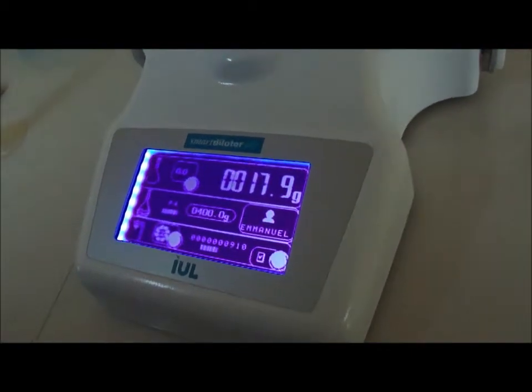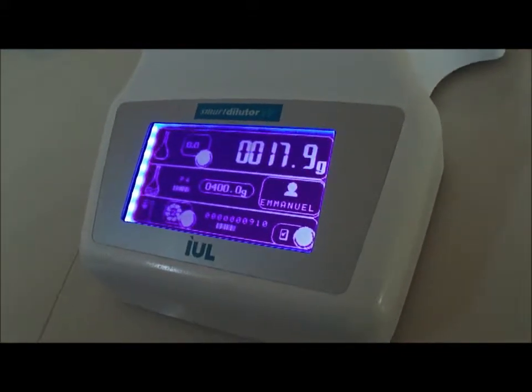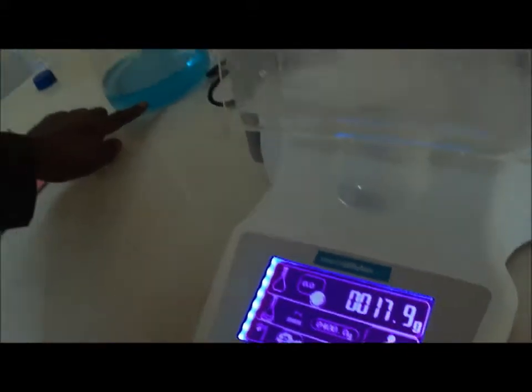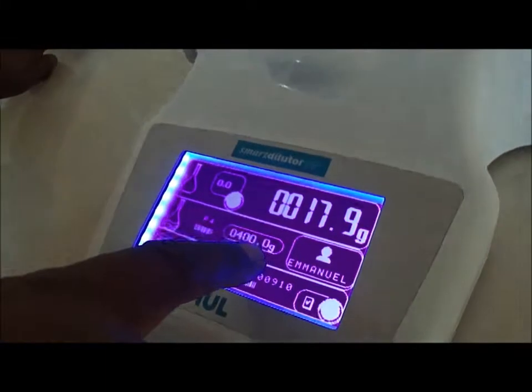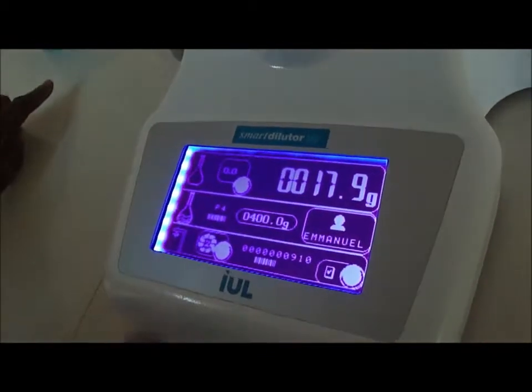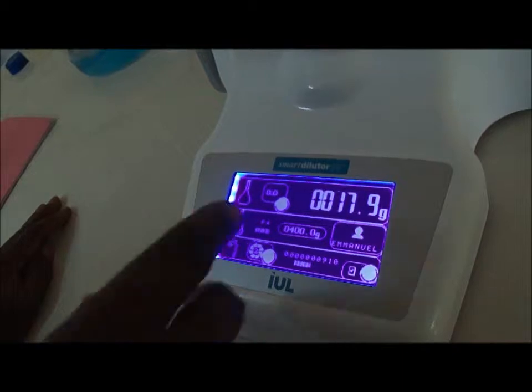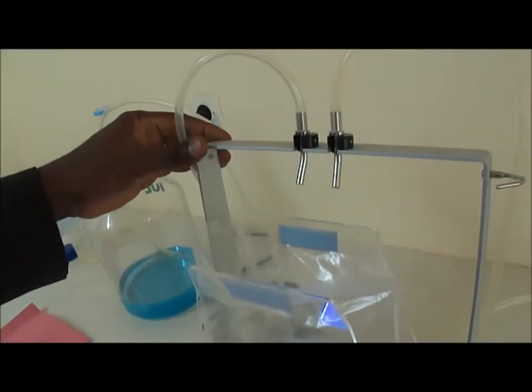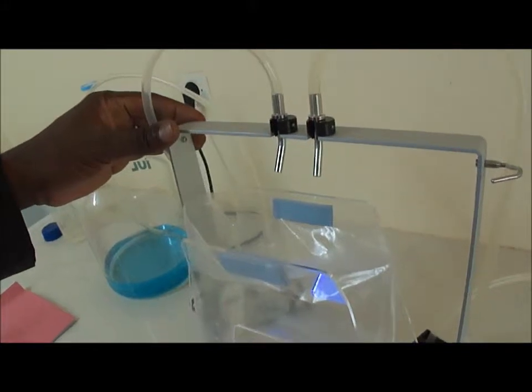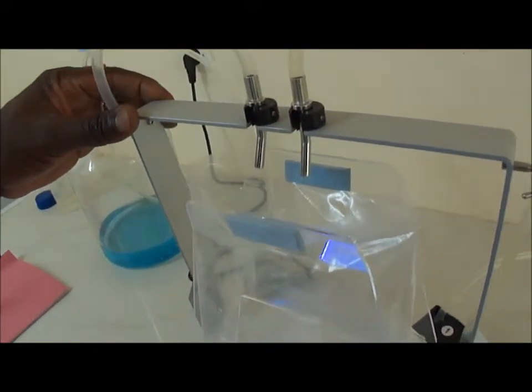This is the sample weight. Now, I use pump number 2. It's here with this blue substance that you see here. And my target weight is 400. So it will add something like 380 grams to complete to 400. Then I push, I pull forward the frame and it should start pumping. Pump number 2.